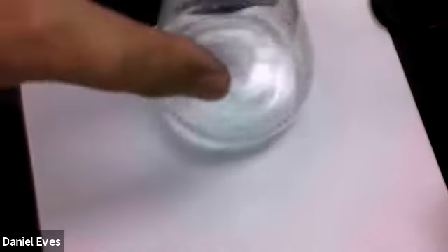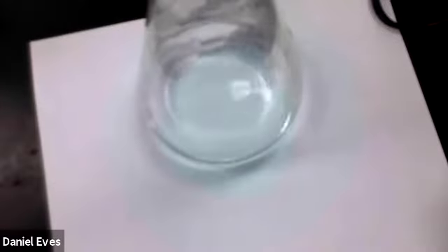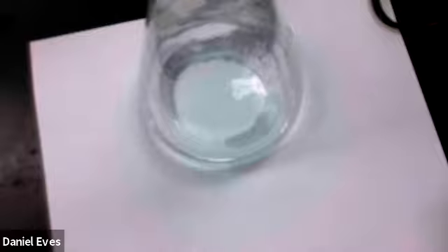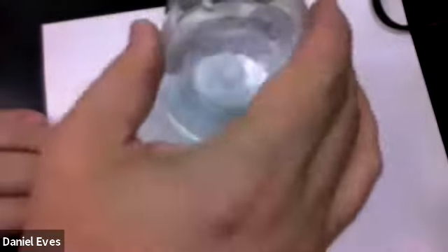Slow it down a little bit because that pink color is persisting. Just a little bit. Pink glow from outside, it looks like. We're still. I missed. Uh-oh. That's going to cause trouble, probably. Left it off the thing. So this one's going to be not as exact as the other one. Oh well, such is life.